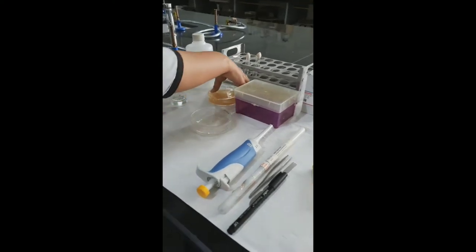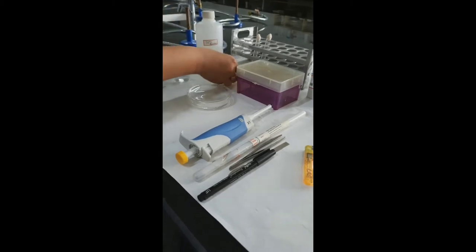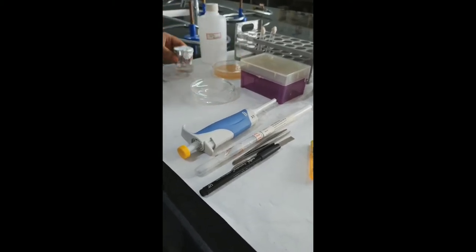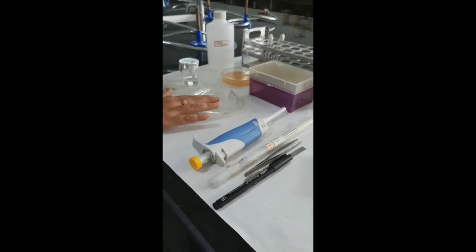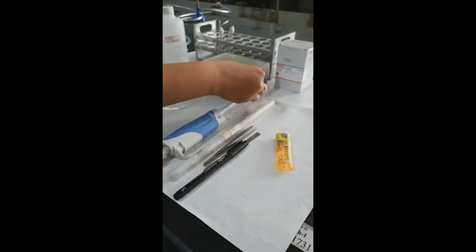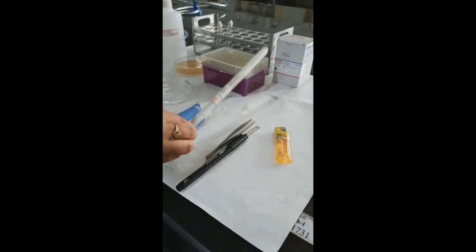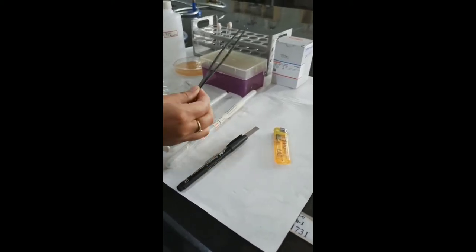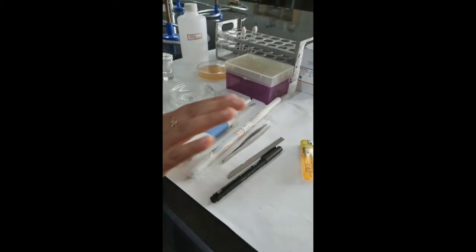Then nutrient agar plate, antibiotic solution, alcohol, tips, micropipette, microloop wire, and forceps. That's all.